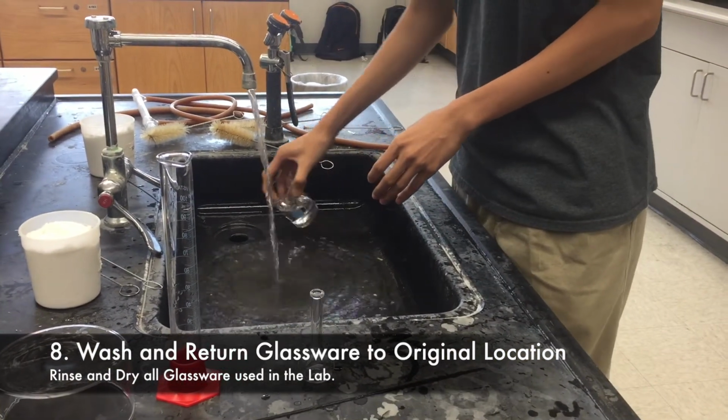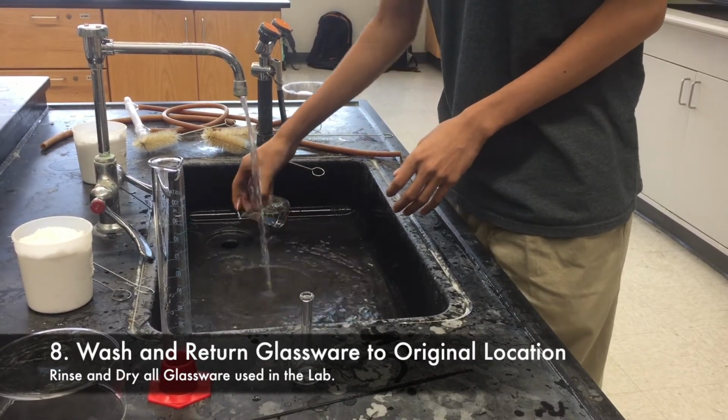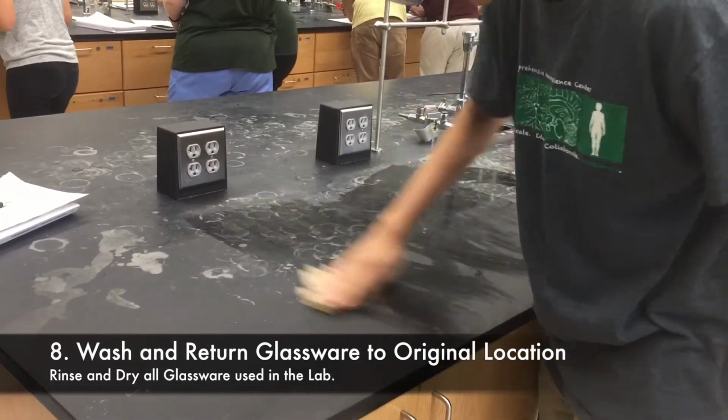Clean and dry all glassware used once you have completed the dilution. Wipe down the lab bench and return all cleaned and dried glassware to their original places. Trust me, nobody wants to clean up after you, and your lab TAs will really appreciate it.